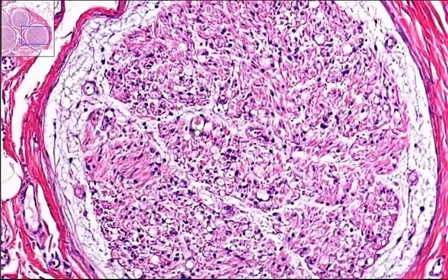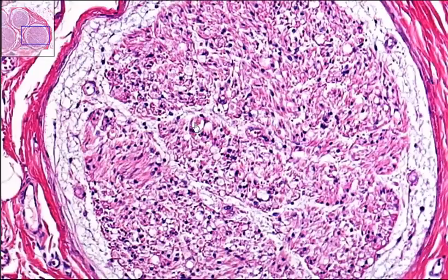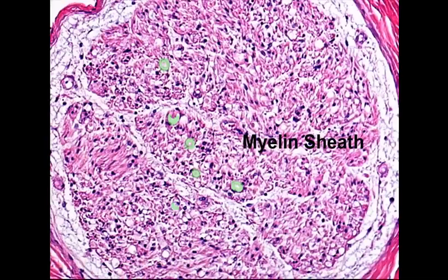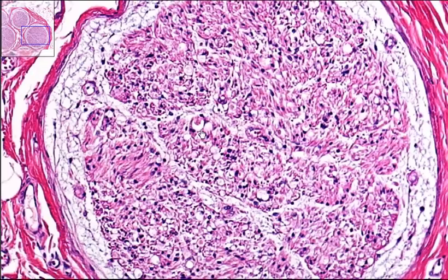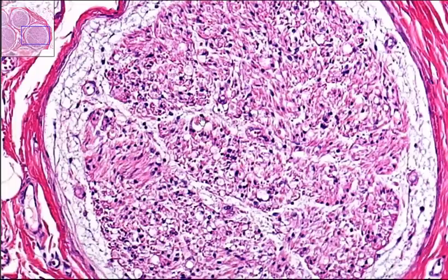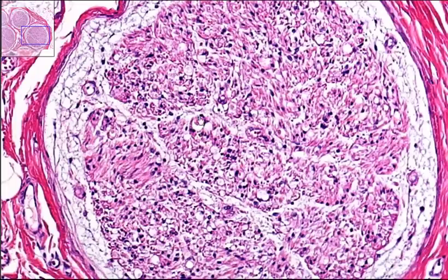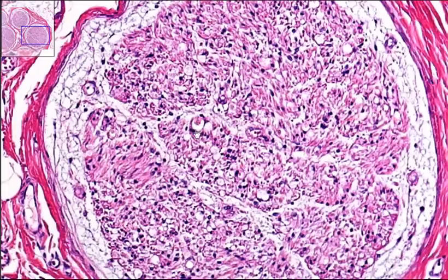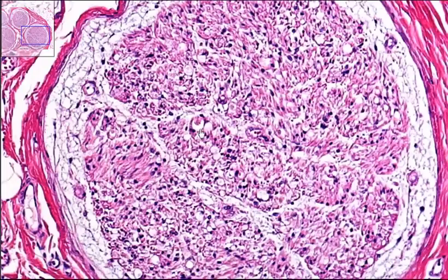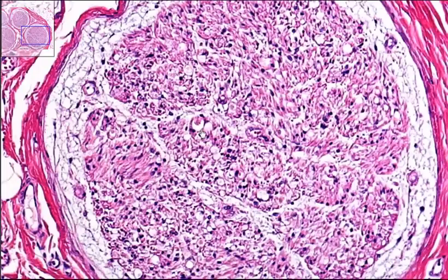The white is the myelination around that axon. And then you have this thin purple line — that thin purple line is a connective tissue covering around the individual axon. That is called the endoneurium.